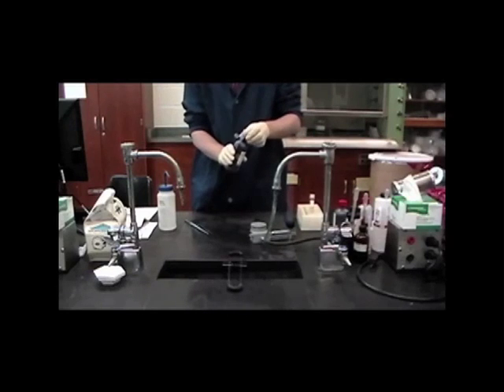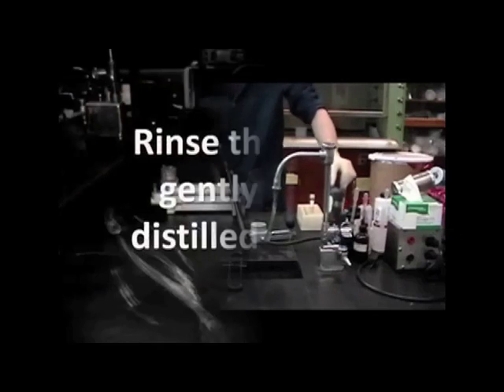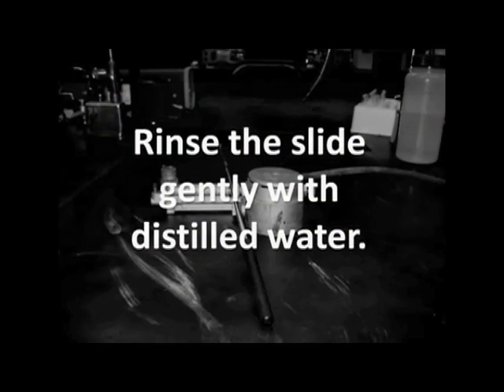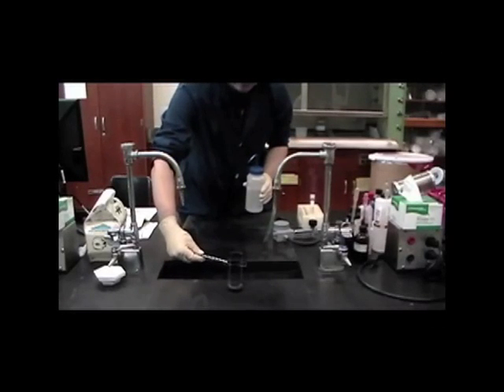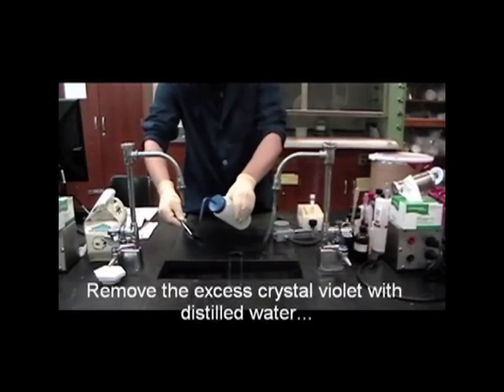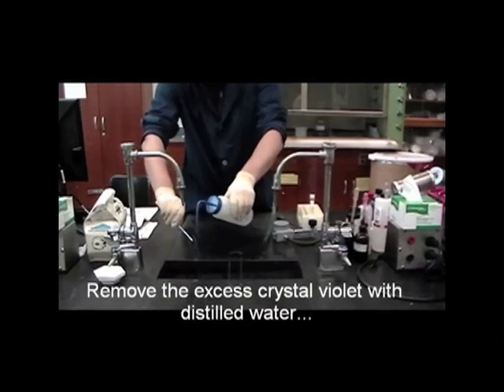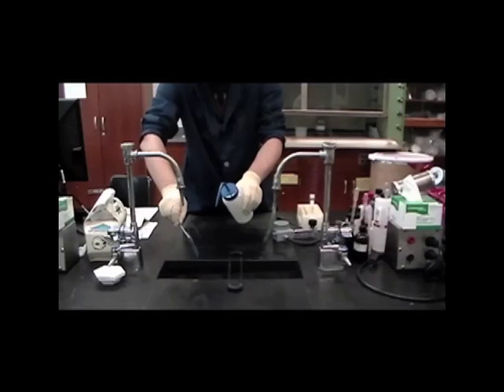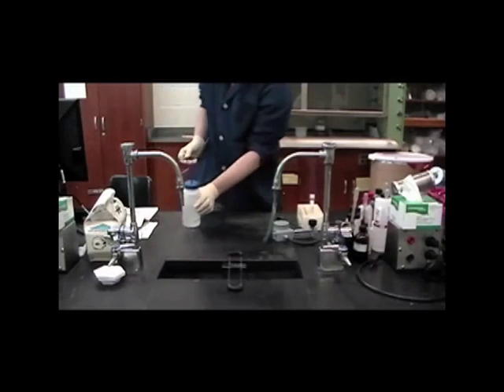There is a 1 minute incubation of the crystal violet stain. The next step is to grasp the slide with a slide holder and gently rinse the slide with distilled water. The purpose of the rinsing is to remove excess crystal violet stain from the slide, with only the crystal violet penetrating the bacterial cell remaining.